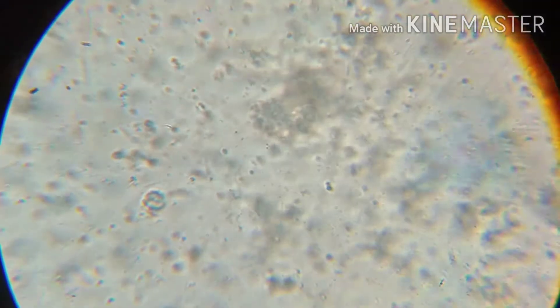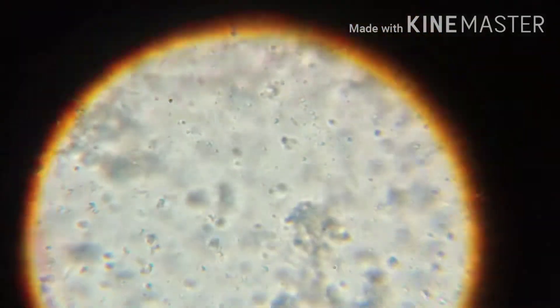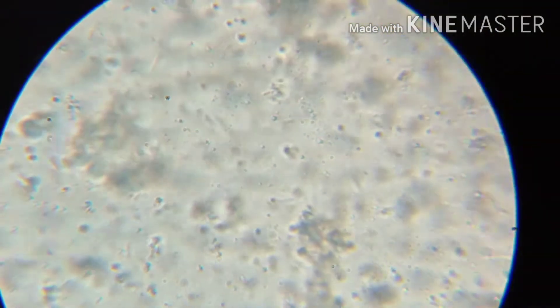This mostly consists of moving fat globules, and the content of fat is more. As I turn on the thousand times magnification, this is what I was able to view — a low content of protein, some bacteria, but a high content of fat globules. The stick-like bacteria visible there is Lactobacillus bulgaricus, and it's kind of less in content.